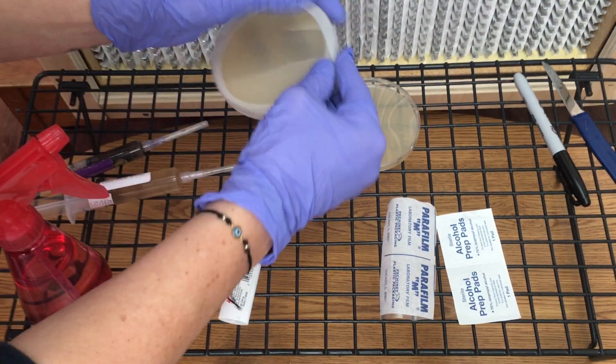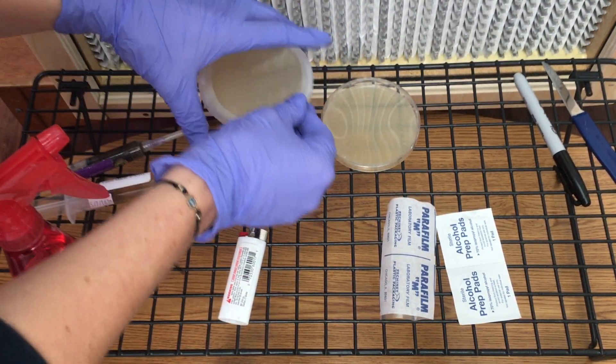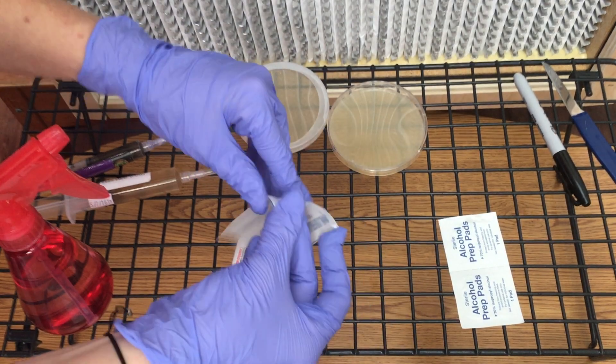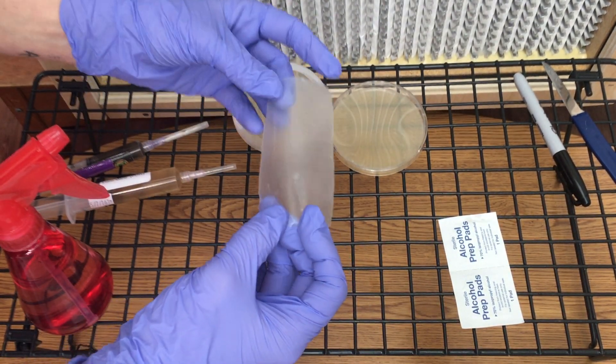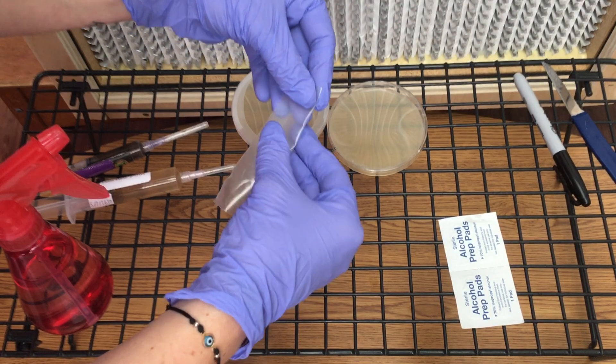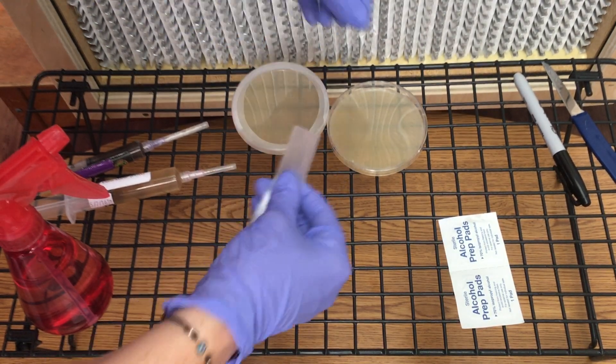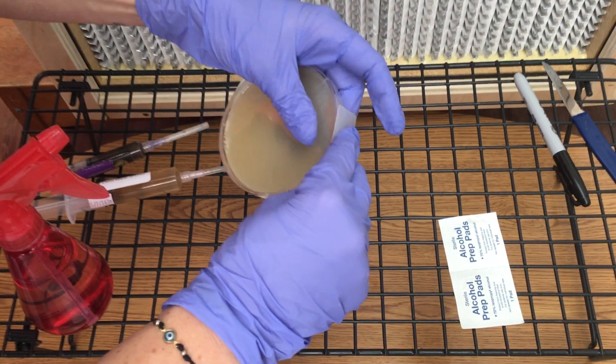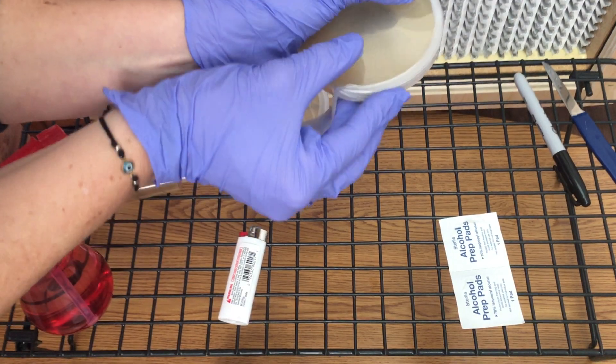And if you have contamination, you'll probably see that before then. Usually I see mold within a day, it happens so quickly. But mycelium growth is a little bit slower, so if you don't have contamination you should see mycelium in about five to seven days.